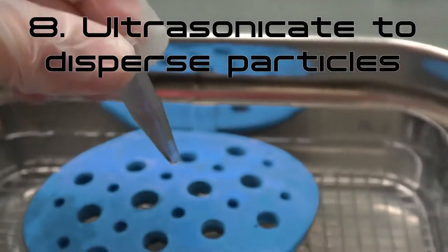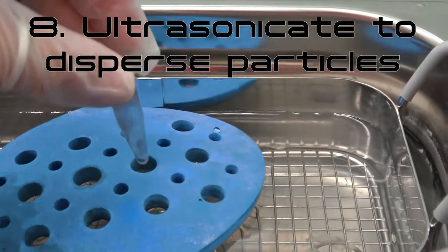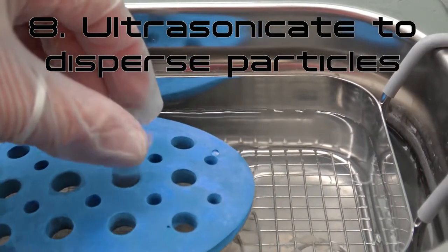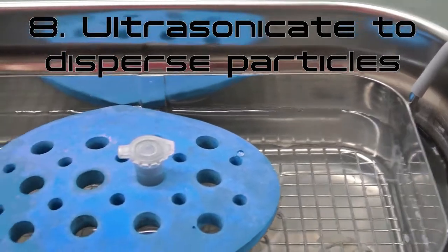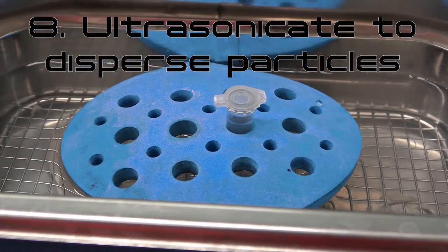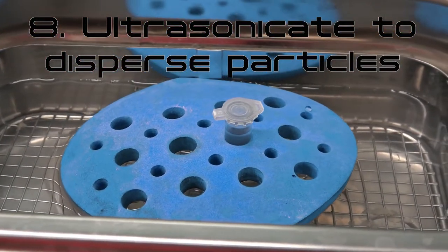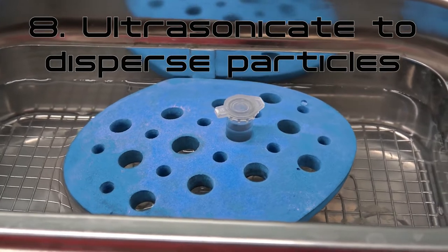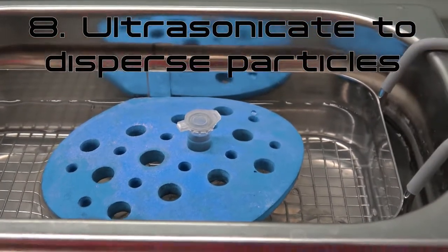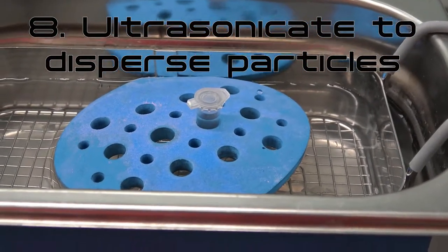Step 8: Ensure the tube lid is securely closed, then ultrasonicate the particles in solution for a couple of minutes to disperse the particles. Remember, do not touch the sample tube or the ultrasonicator while the ultrasonicator is in operation.